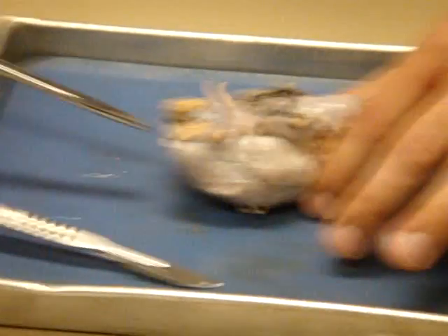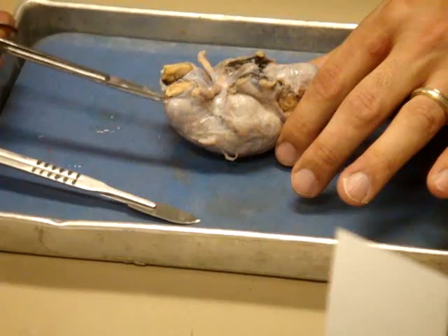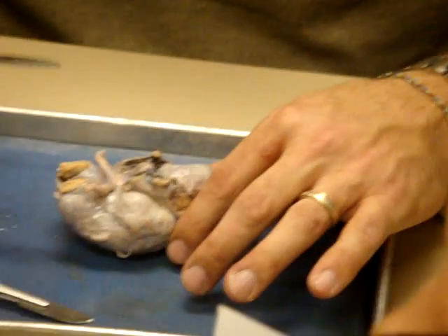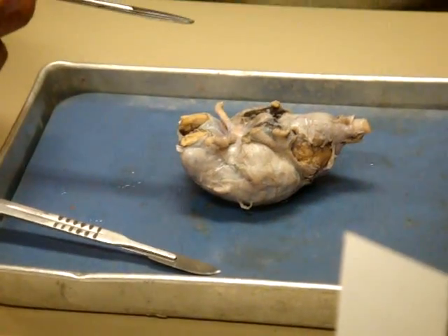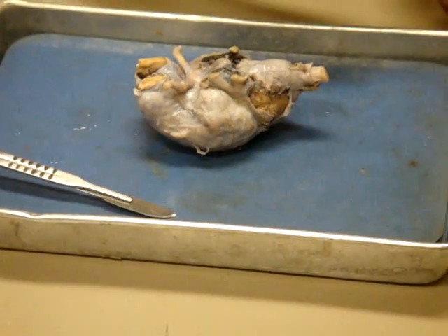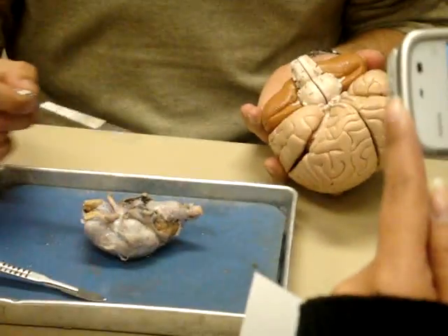Okay, this is the frontal lobe, and underneath it, this is a cranial nerve. Any idea what that one might be? Olfactory. Good, that's cranial nerve 1, olfactory. They're going to be right going down through that ethmoid bone and right into the nasal cavity. Little nerve endings will come off of this into the nasal cavity. We call these olfactory bulbs, and in the human we can see they would be right here and then they continue back as cranial nerve 1. They're a lot bigger in the sheep than they are in the human.